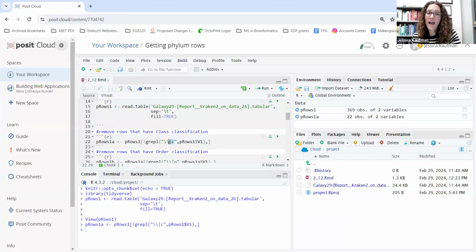It's looking for this pattern, pipe C. That's what all of the classifications will have. And anytime it finds it, it gets rid of it. I searched all of pRows1, that data frame, for that pattern using the grepl tool. We did this in the tutorials to compare words. It's basically like a word match tool, and it gives true or false. So grepl category will come back true.